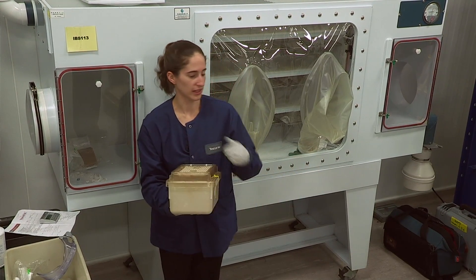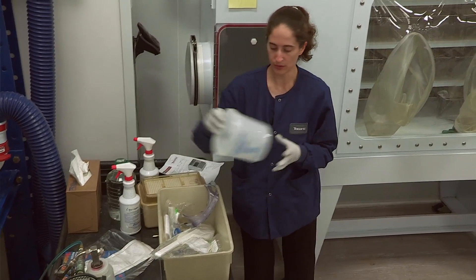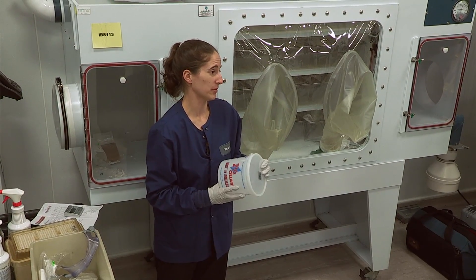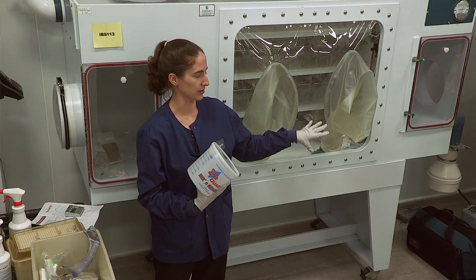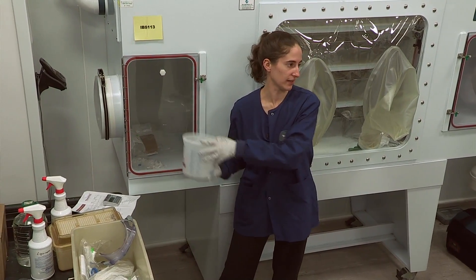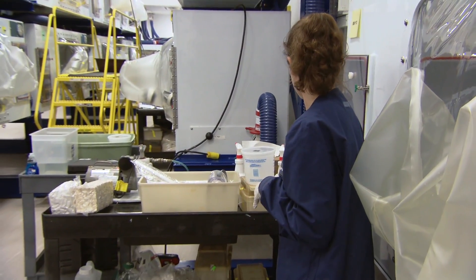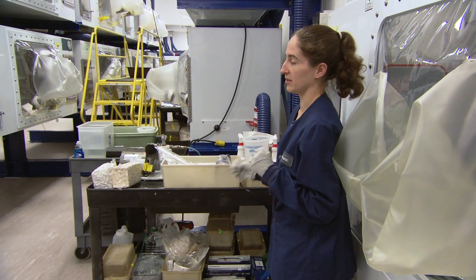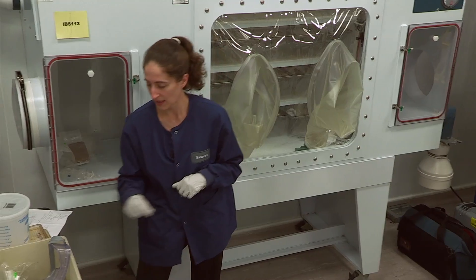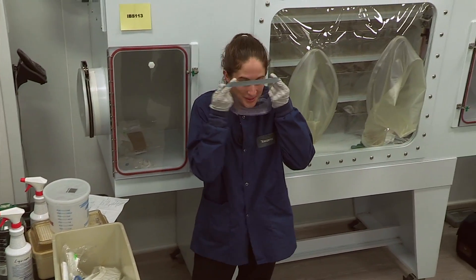When you put the container in the isolator, you would want to mist it off. If using a Nalgene container with a screw-on lid, you'd again have to be very quick — unpack the animals in the hood, get them over, mist it off, get it in the isolator, and put the animals away. When you're putting supplies into and out of the isolator, you want to do things as minimally as possible — moving things in and out is where your biggest risk point is.